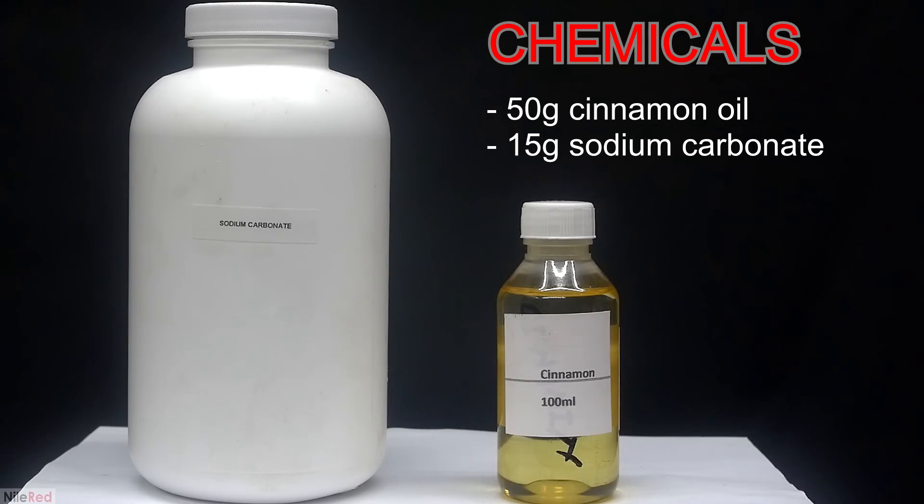In terms of chemicals, we need two major ingredients, cinnamon oil and sodium carbonate. The sodium carbonate can be pretty easily made from baking soda and I already have a video showing how. The cinnamon oil contains the cinnamaldehyde that we need and it can be easily purchased online.